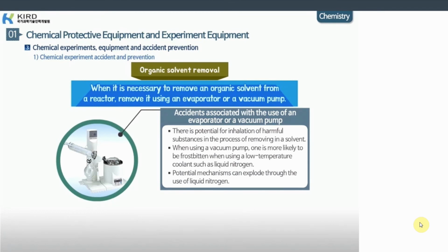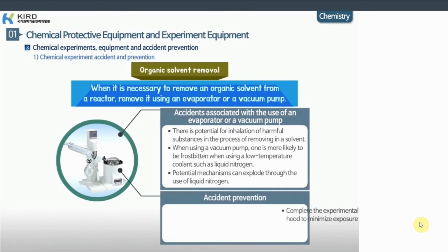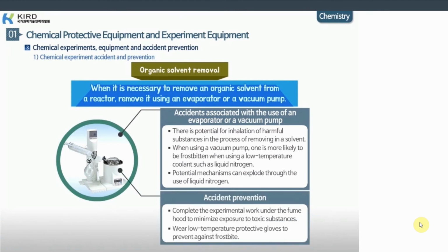When using a vacuum pump, one is more likely to be frostbitten when using a low-temperature coolant such as liquid nitrogen. Potentially, mechanisms can explode due to the use of liquid nitrogen. To prevent an accident, complete the experimental work under the fume hood to minimize exposure to toxic substances, and wear low-temperature protective gloves to protect against frostbite.